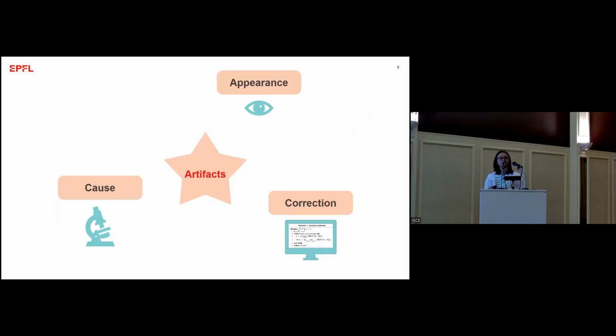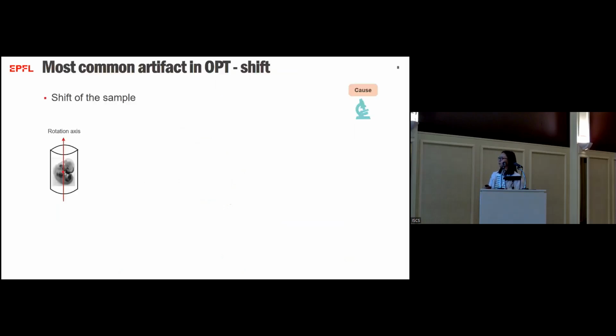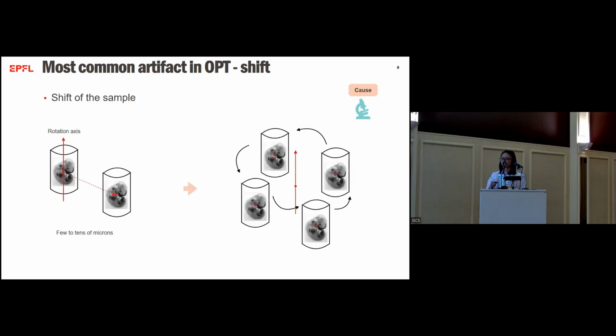When we look at artifacts, we try to approach them from three aspects. What do they look like? What causes these artifacts? And how do we correct them? So following this approach, we're going to take a look at the most common type of artifacts in OPT, the shift of the sample. In the ideal case, the sample is aligned with the rotation axis, and it's rotating around the rotation axis. But in practice, typically we have a small shift of the sample so that it's off center by a few microns. Then the sample is rotating kind of in a circle.